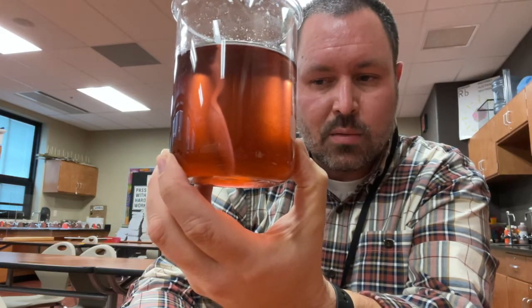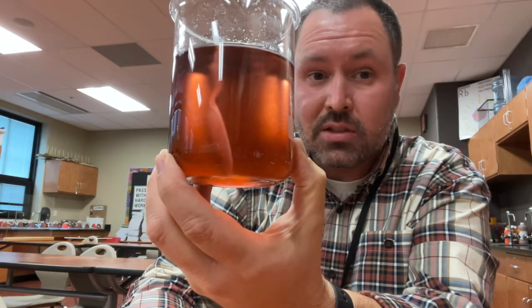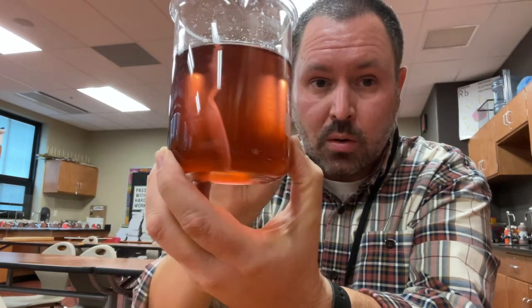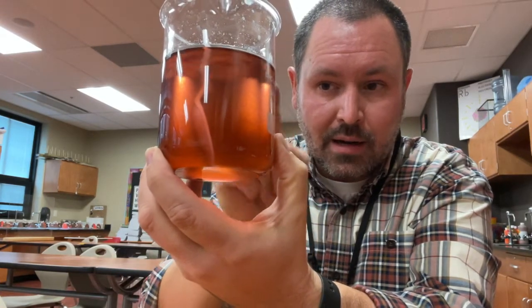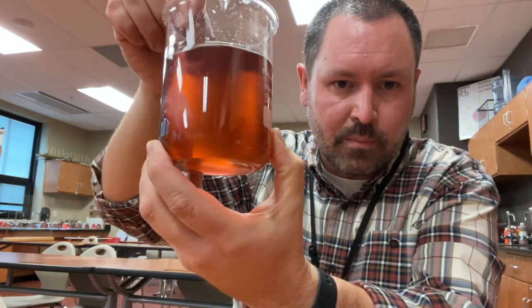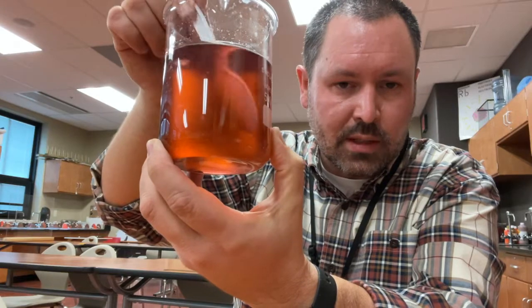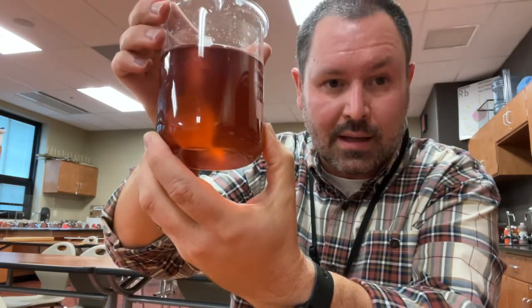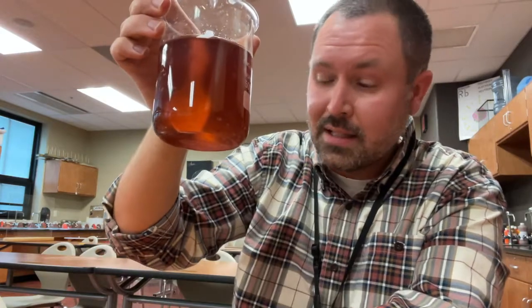And when it is in its semi-solid form, nothing settles out. So let's pretend that here, even though something here has settled, it's in its semi-solid form, and we have cooled it to the point where it's Jello, and it doesn't settle out. If it doesn't settle out, that should give you a clue as to what this is.